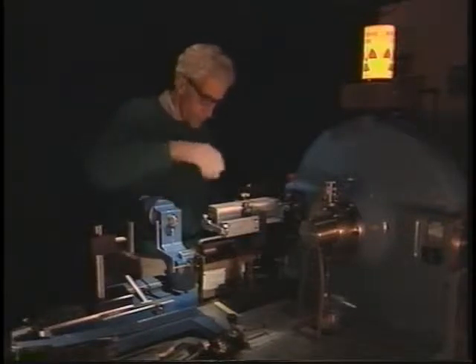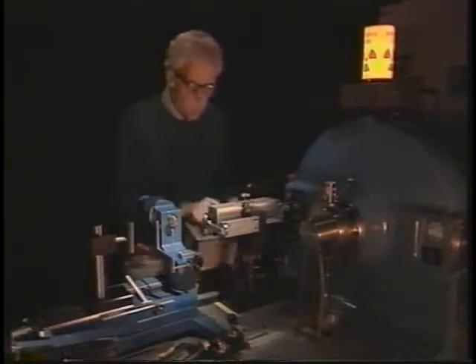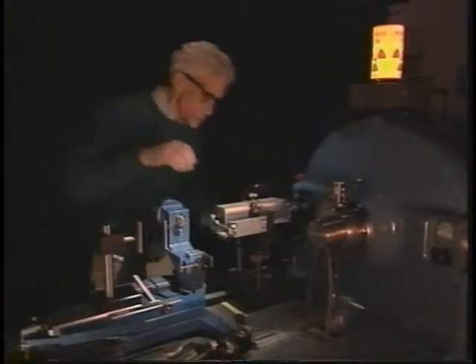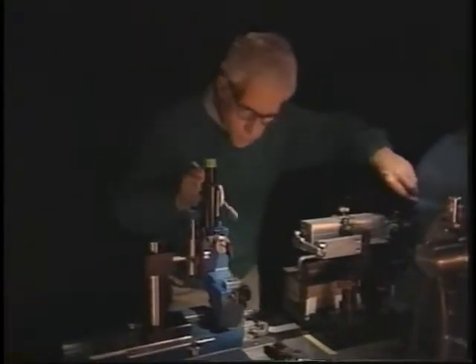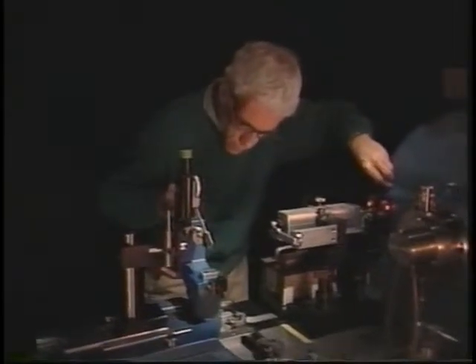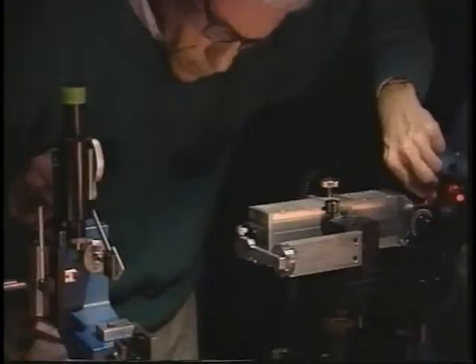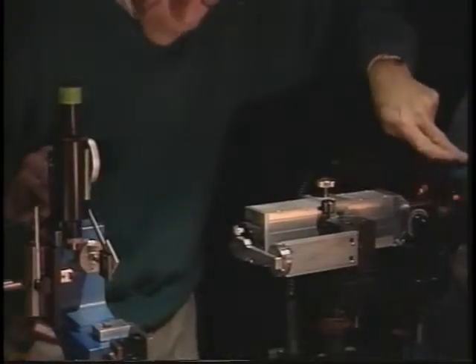Past measurements with multiple finger and collar dosimeters during the alignment procedure have shown no reportable dosimeter response. A monitoring badge provides a record of any cumulative exposure. Of course, the most significant X-ray hazard is the beam itself. The dose rate in the direct beam is tens of thousands of rems per hour, which means almost any exposure can result in skin burns.